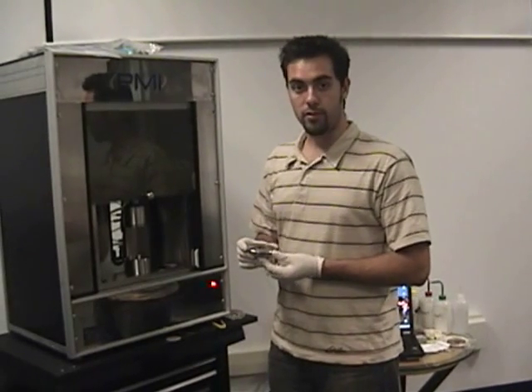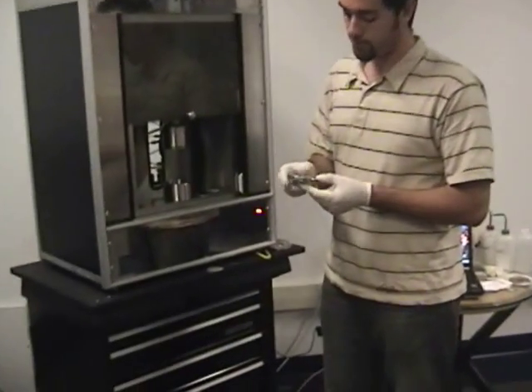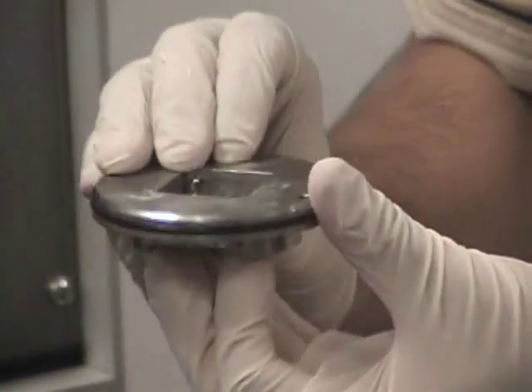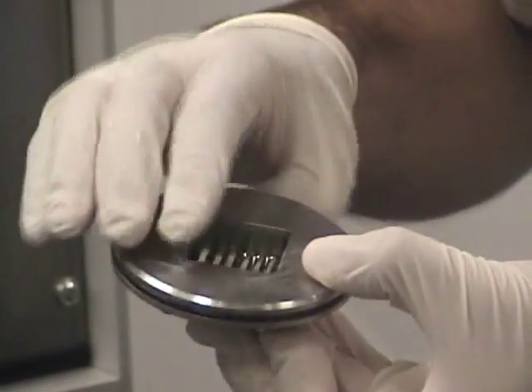This video is to show you how to run a hollow fiber test. After gluing your samples into the plate, it should look like this, with six strands.